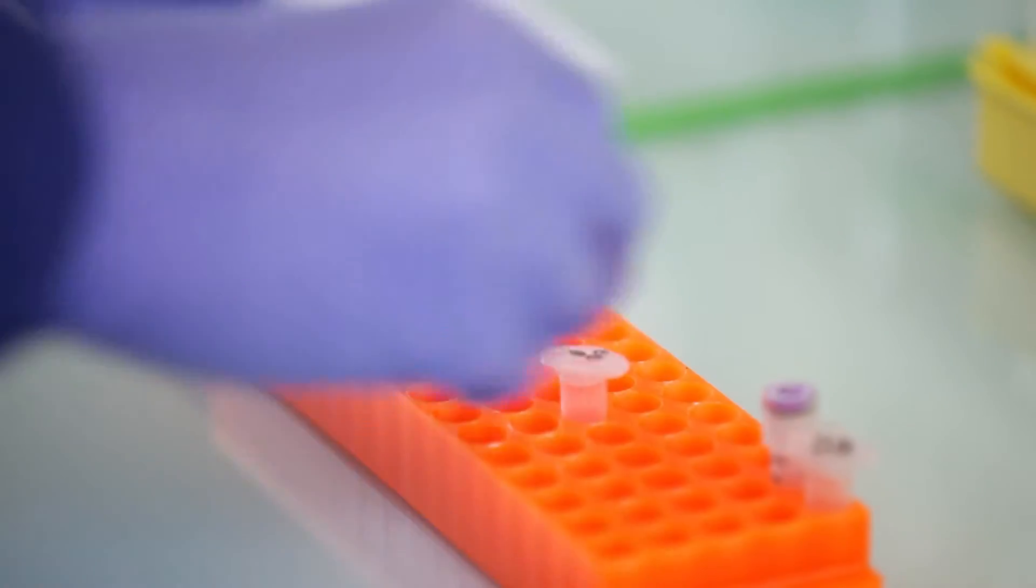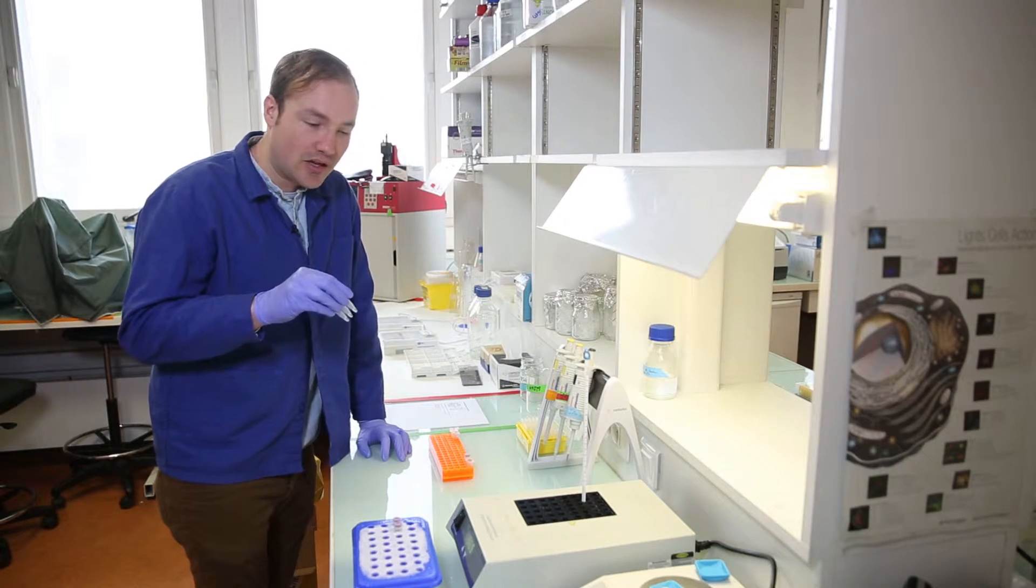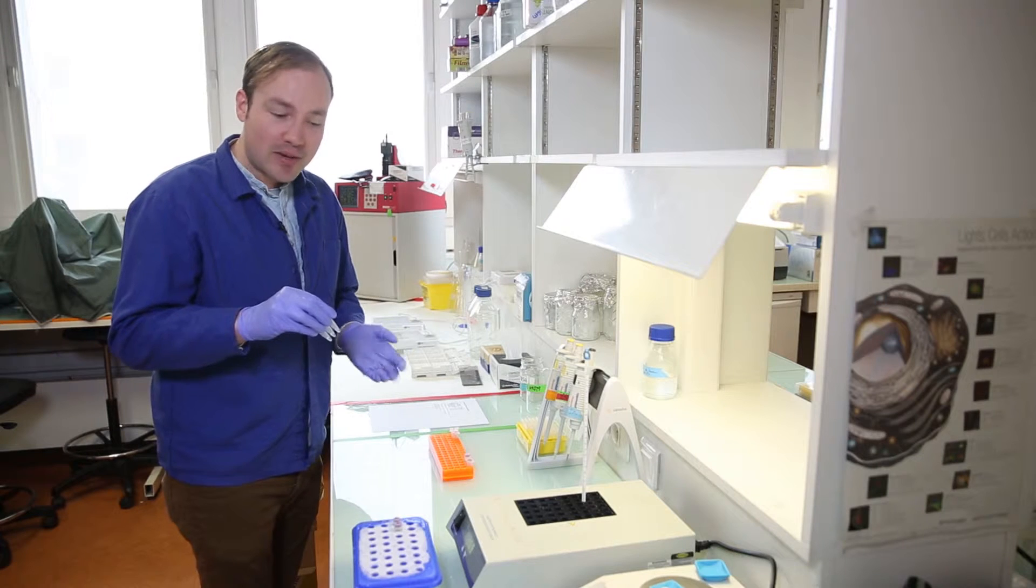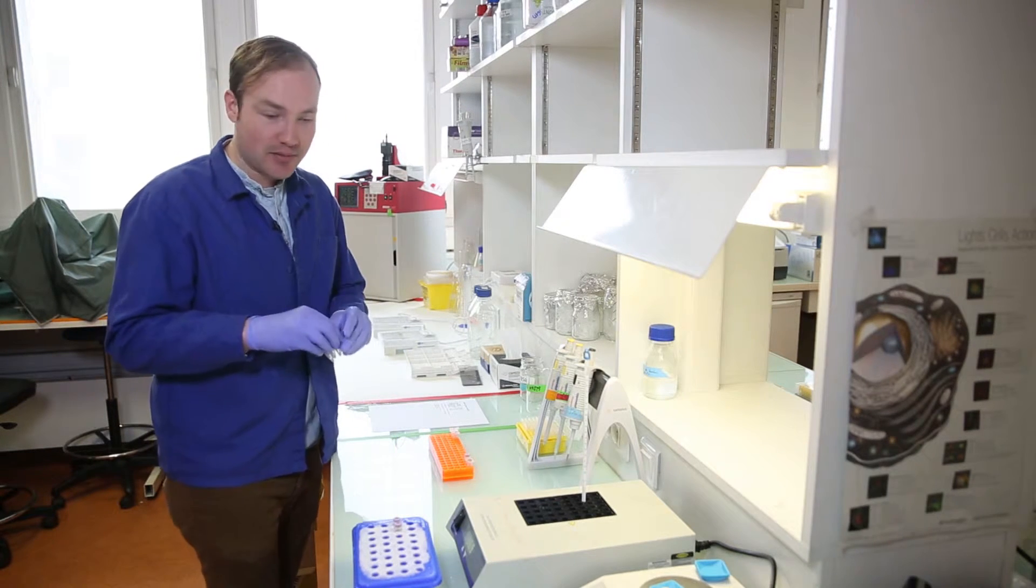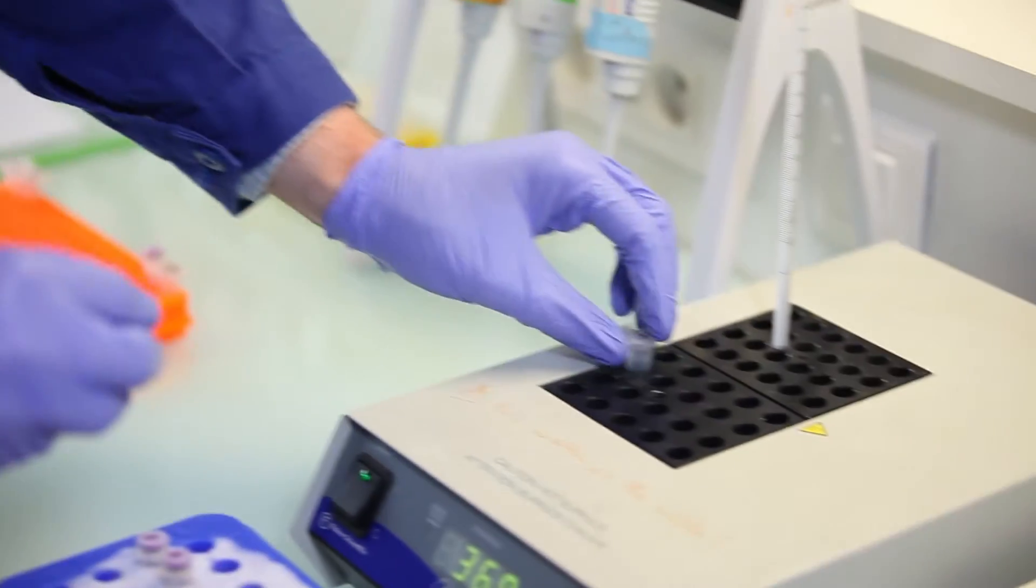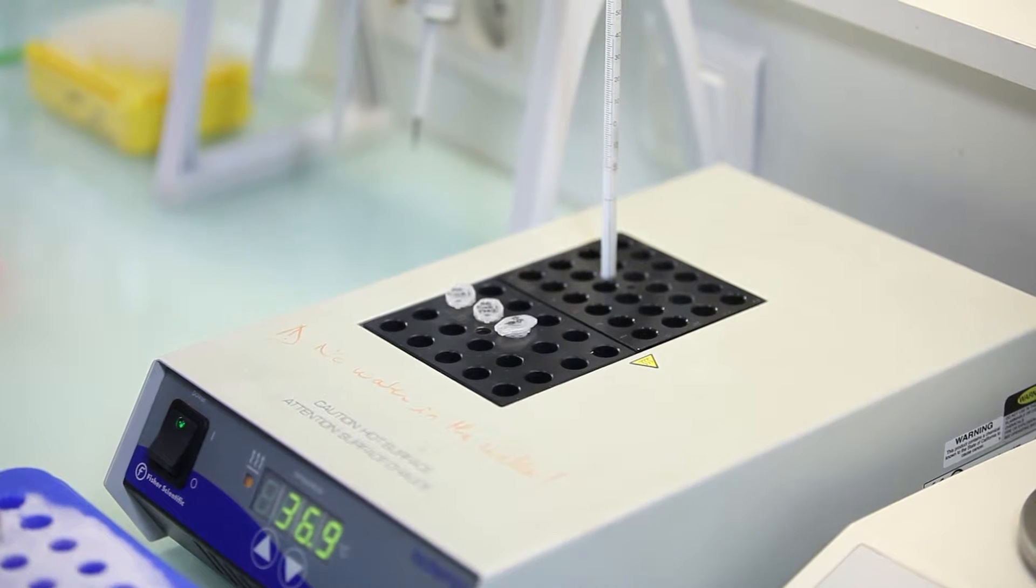Now, we'll incubate the reactions at 37 degrees for five minutes or an hour or whatever time is indicated by the manufacturer. For this protocol, we'll leave them for about an hour.